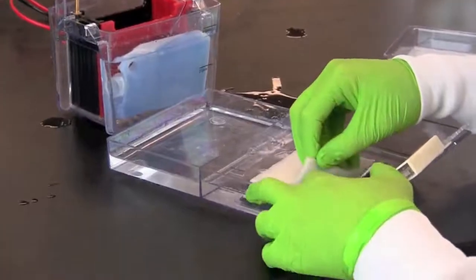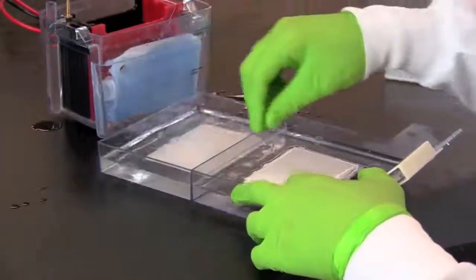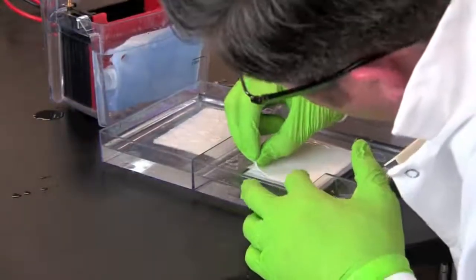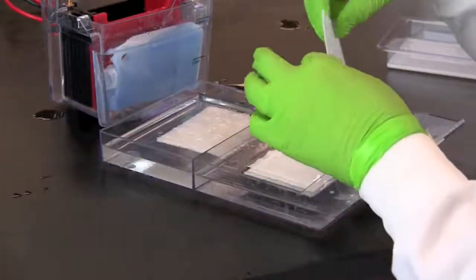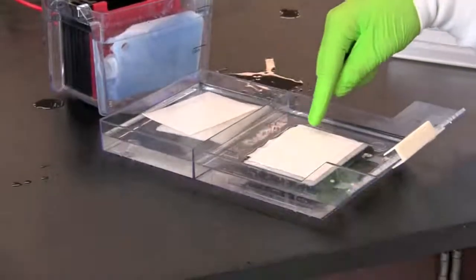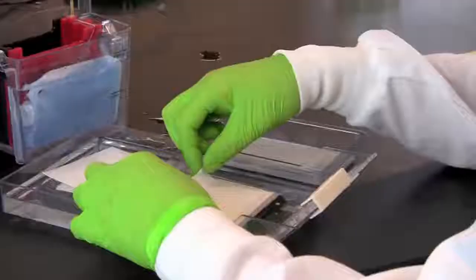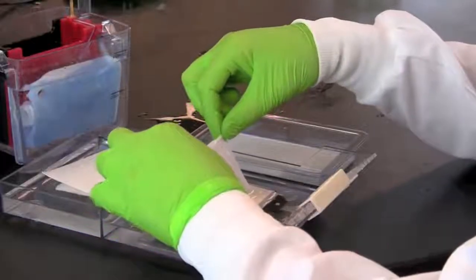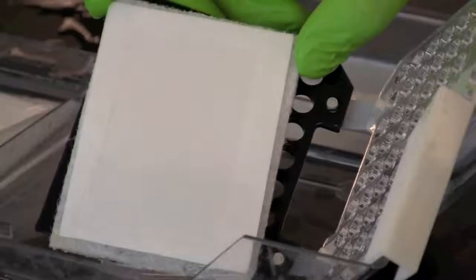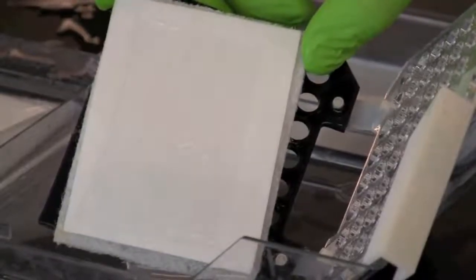Starting with the first fiber pad, remove each layer until you reach the nitrocellulose membrane. As you remove the membrane, note that the proteins have been transferred from the gel to the membrane. Note that the kaleidoscope pre-stain standards have been transferred and can be seen on both sides of the membrane. You can also see that there are no longer any proteins on the gel.